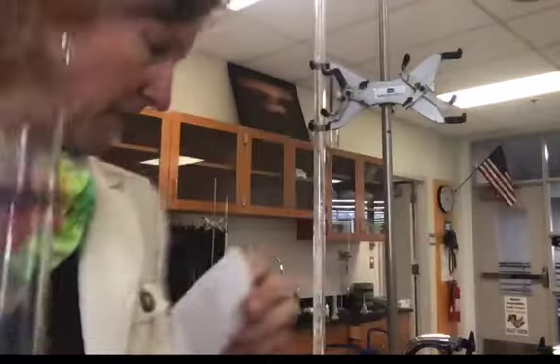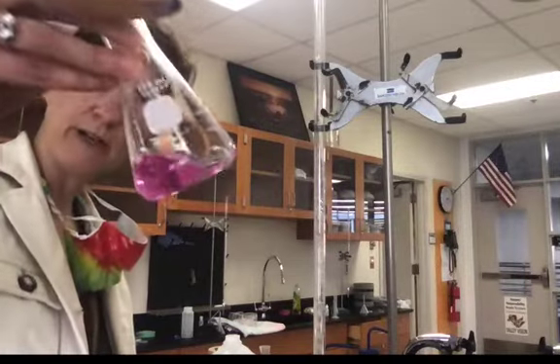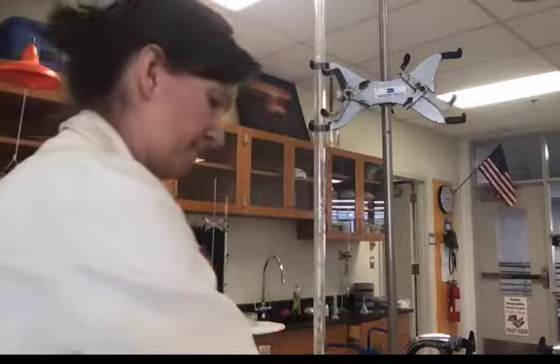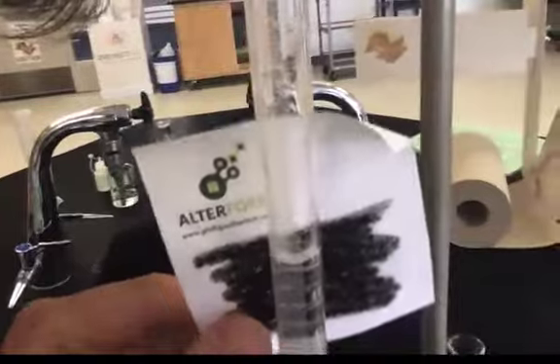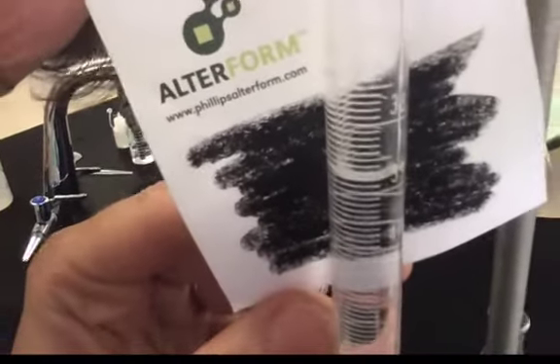Volume for your fourth trial. Final color for your fourth trial. And the final burette reading for your fourth trial.